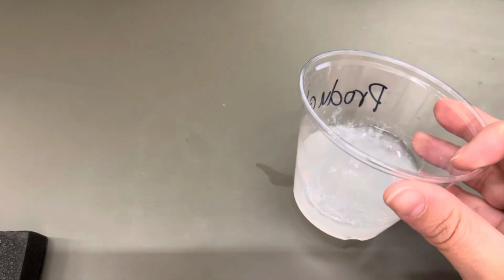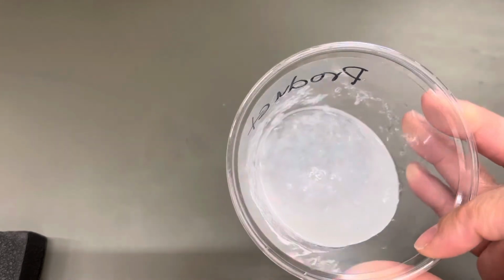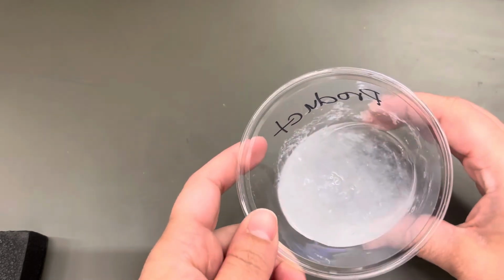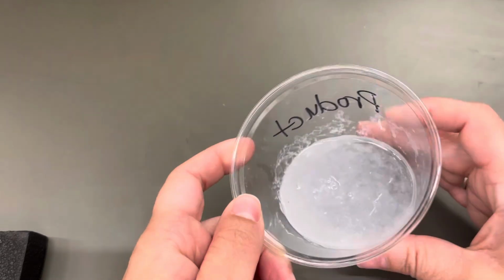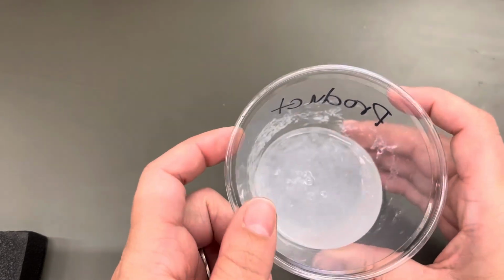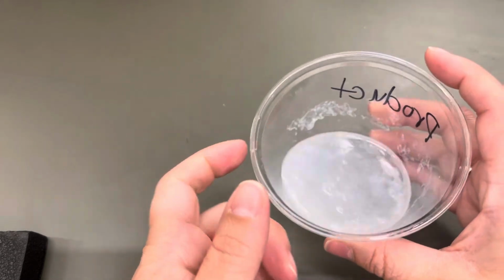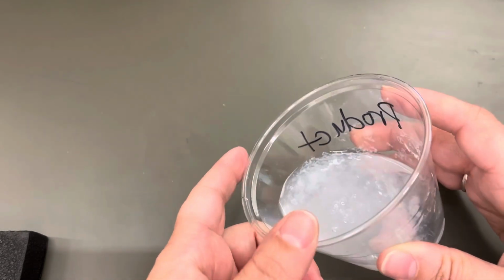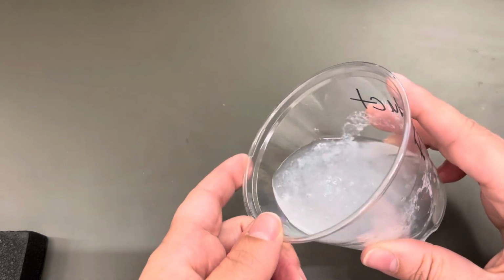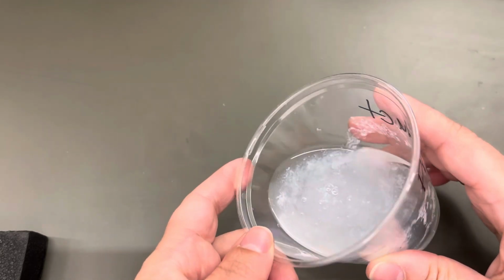So as you let it sit, you should see that it's getting thicker and thicker, and there's actual solid in there. So there's a name for the solid that is made when you combine two liquids. If you remember when we learned about the 5 signs of a chemical change, or chemical reaction, there's a name for the solid that is formed, and it's called the formation of a precipitate. A precipitate. So that solid in there is a precipitate. You see that solid in there?